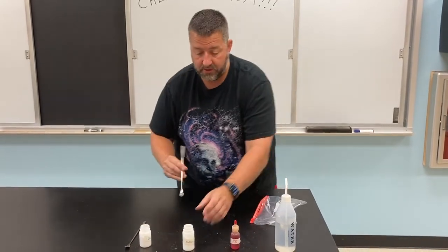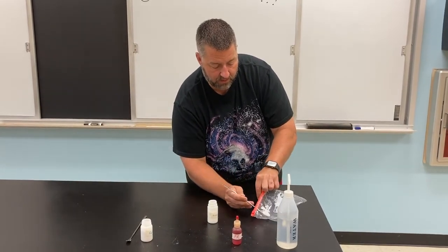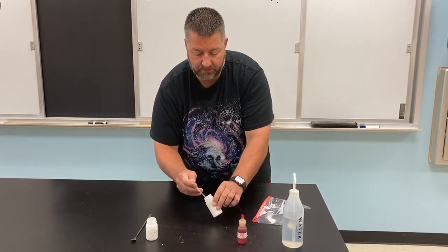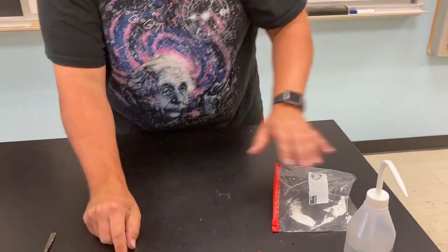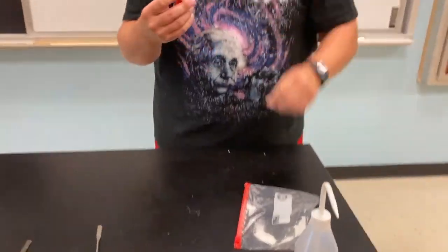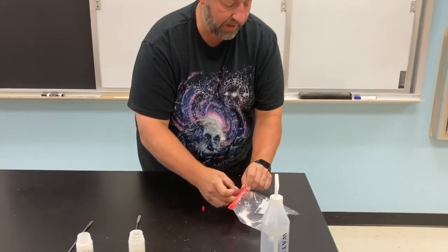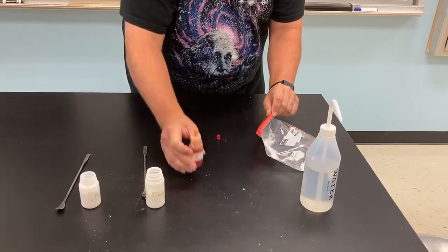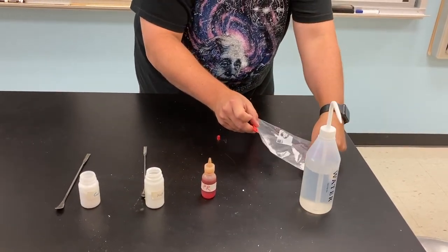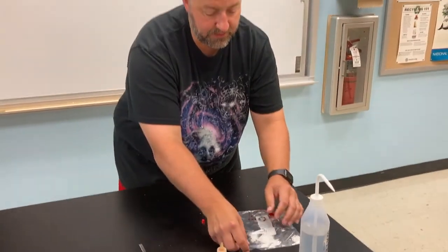I'm going to use a different spatula for my sodium bicarbonate. That I'm going to put up here. If Mr. Van Grandel zooms in here, you can see that I haven't mixed the two solids yet. They're separate, so nothing is reacting. Now I'm going to put the phenol red in. Now, as I said before, phenol red is phenol red and water. So this is actually two substances in one. I'm going to try to squirt that into the corner of the bag over here, away from everything. Okay. And then I'm going to flatten the bag out, Ziploc it, and then we're going to mix these together and we're going to see what happens.